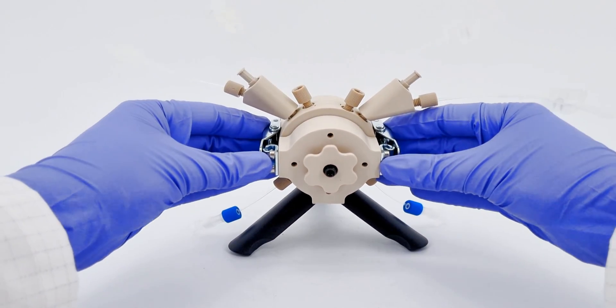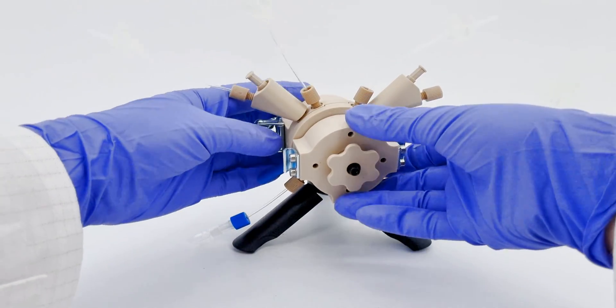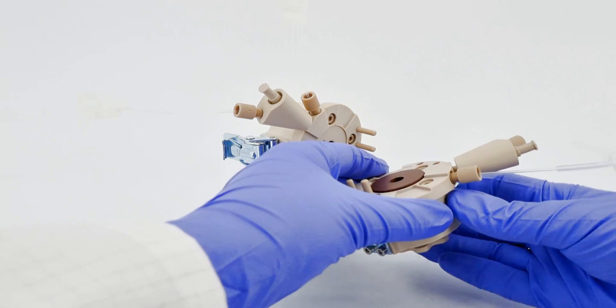Moving on, we'll access the inner section of the cell. To do this, open the metal clasps at the same time and gently pull apart the cell halves.